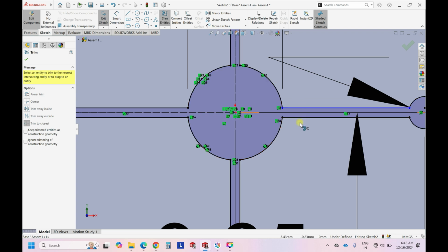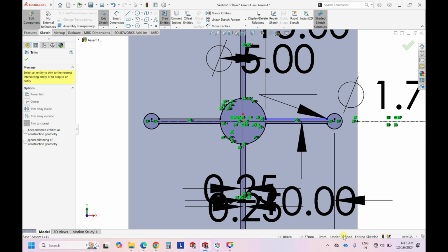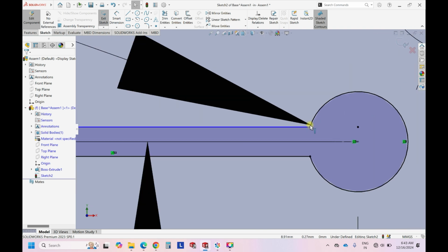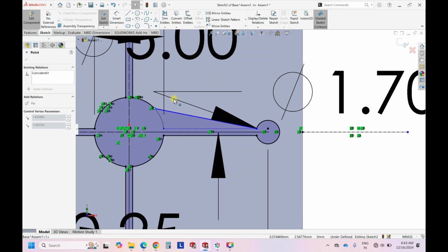But I always recommend in my previous videos also that the sketch is underdefined now. So for example, if you see this blue color line, this is the reason that the sketch is underdefined. Unfortunately there is a small movement here. So this movement happened unknowingly, and this results in an error in designing. So this you will notice after you complete all the designing.